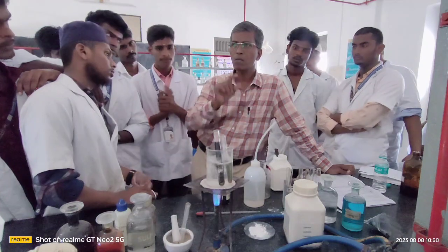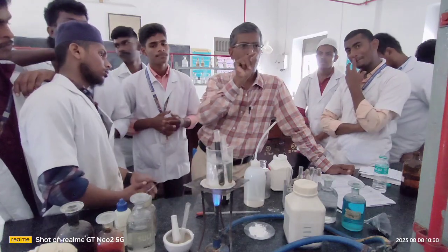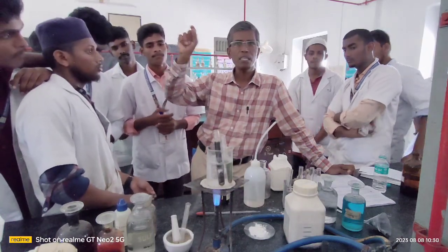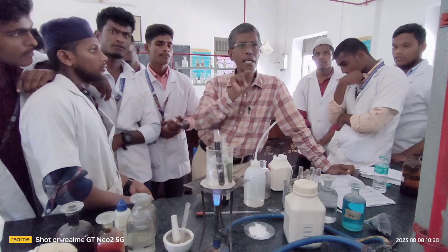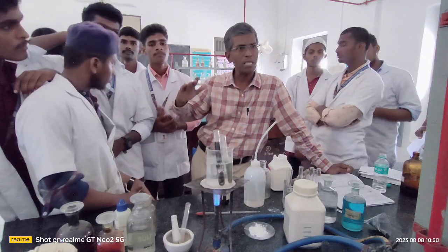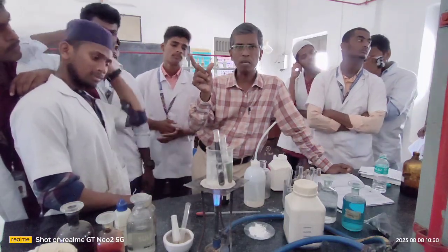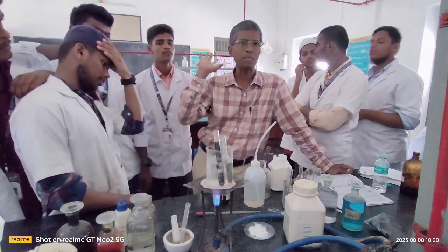And after the procedure is over, you write down a report, cleanly stating whether the given organic compound contains the following things. Number 1, aliphatic or aromatic, give a hyphen, then write down the answer. Then saturation or unsaturation, write down your answer. Then the elements present. If nitrogen is there, write down nitrogen is present, and the rest of the elements absent. And finally, you write down the functional group present, the functionality of the given organic compound. If possible, write down finally the derivative of the corresponding organic compound.